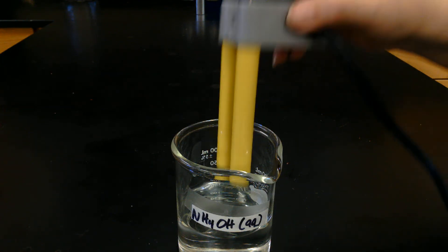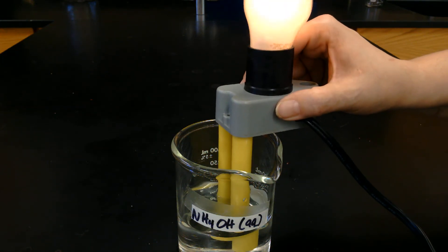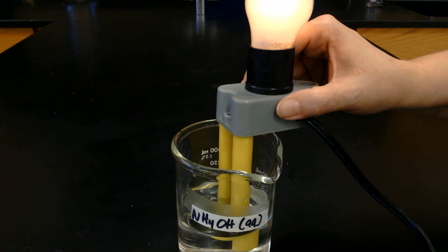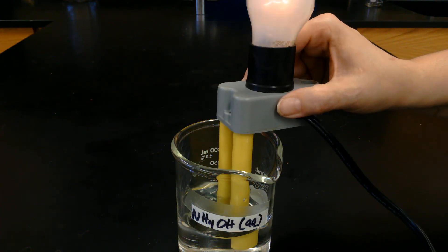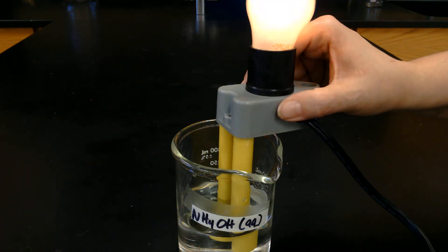Next we're going to try some ammonium hydroxide. It's lighting up barely there. Go ahead and make your observation.